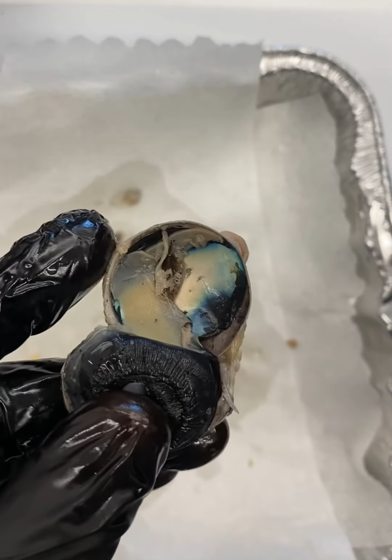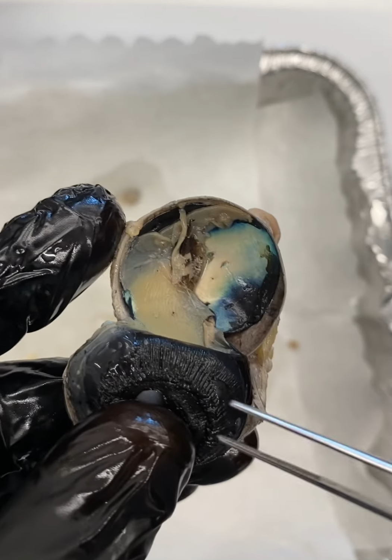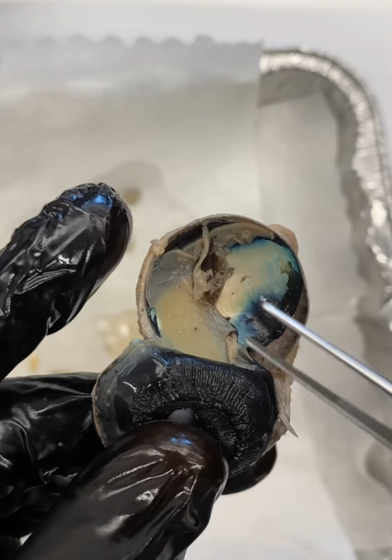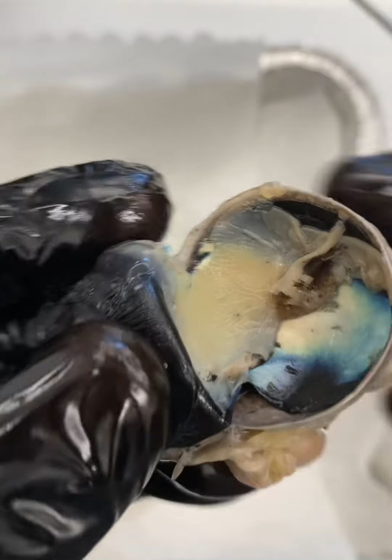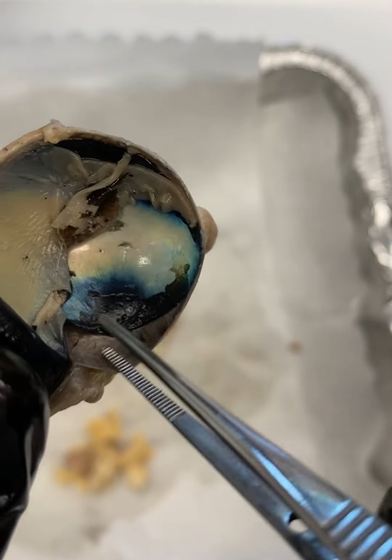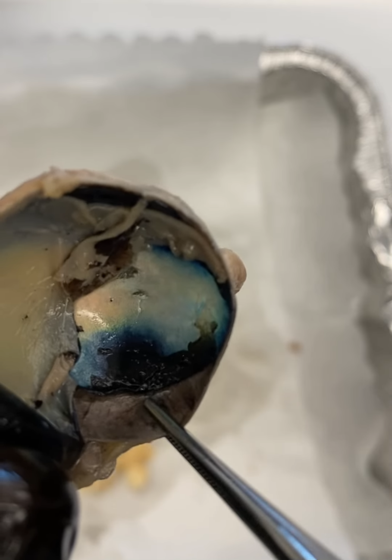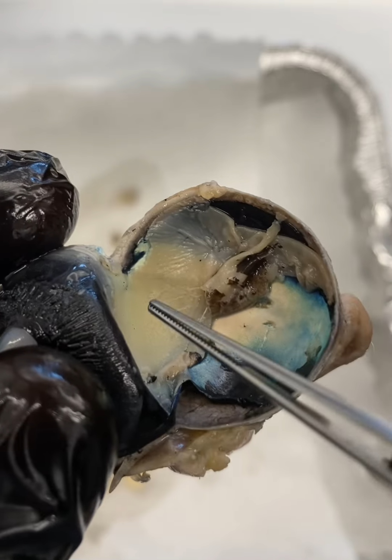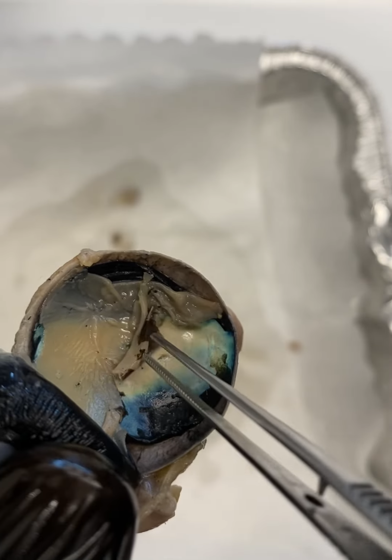This is an anatomical feature that we as humans do not have, but animals such as cows and dogs and sheep do have this tapetum lucidum. And then the inner layer here, sometimes called the vascular tunic, is the choroid. So the sclera is the fibrous tunic, the choroid is the vascular tunic, and then here we have finally our retina, which has kind of been torn on this side. You can see part of it right here.